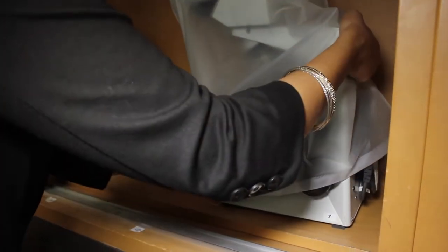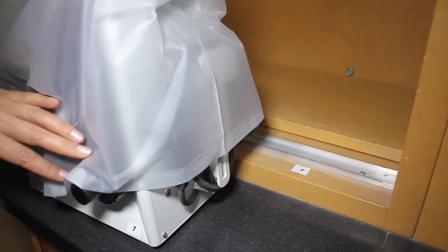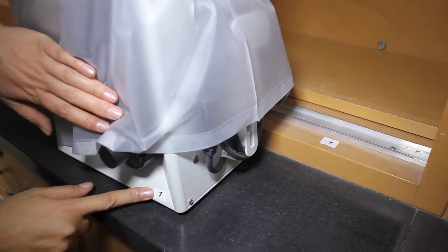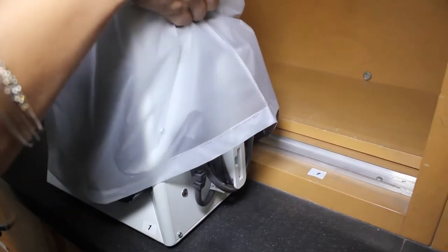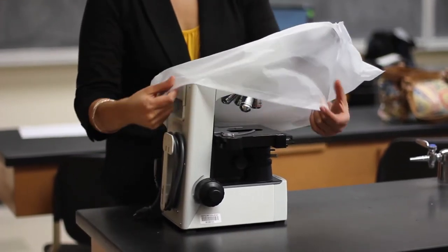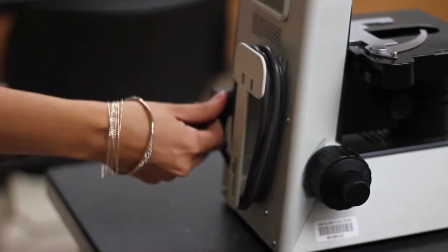In your biology class you will be assigned a particular microscope and you will be responsible for the care and storage of the microscope throughout the semester. Each microscope has a number indicated on the base of the microscope and is stored in the corresponding shelf space in the cabinets. While not in use, the microscope should be stored under a dust cover and the power cord should be neatly wrapped in the back.